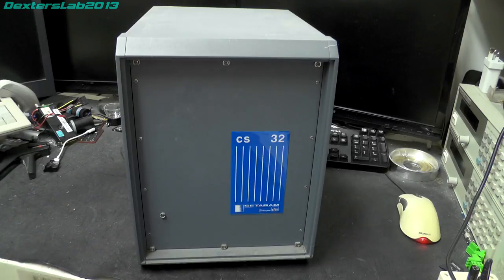What I would say is, looking at it from the outside, it looks to be quite a well-made unit. It looks like they've spared no expense. It'd be interesting to see on the inside what's going on.